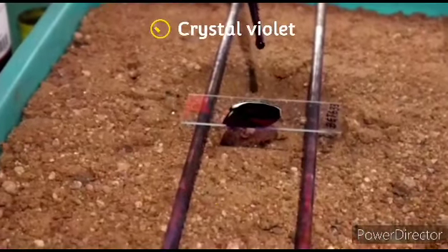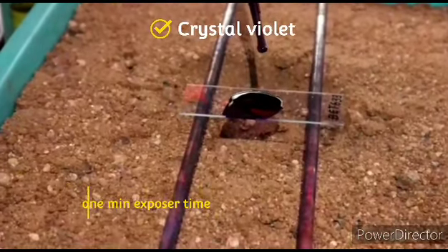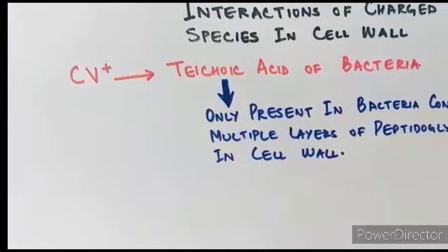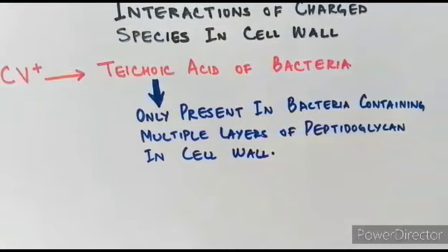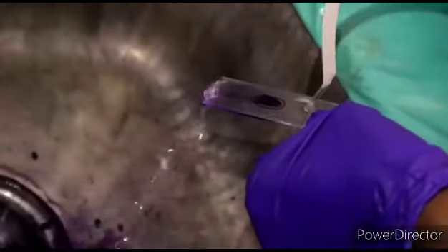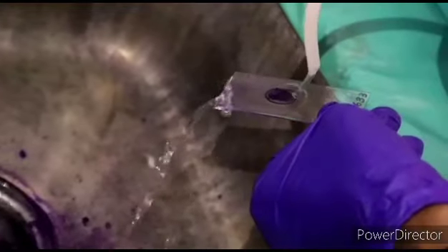The primary stain, crystal violet, is poured covering the smear. The positively charged crystal violet reacts only with the teichoic acid, which is present in the multiple-layer peptidoglycan in Gram-positive organisms. The slide is water washed.